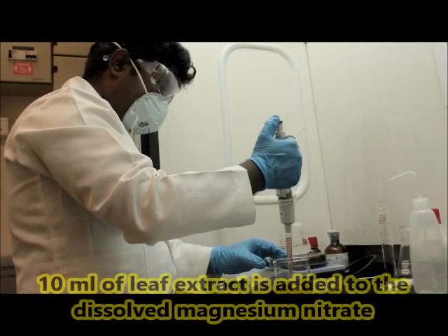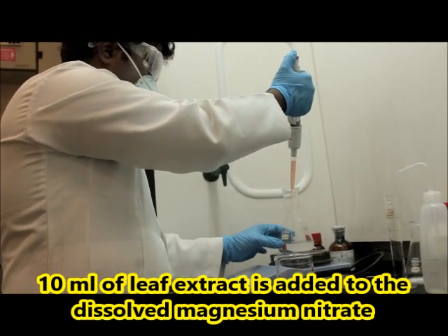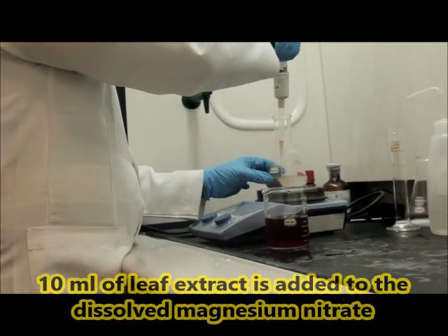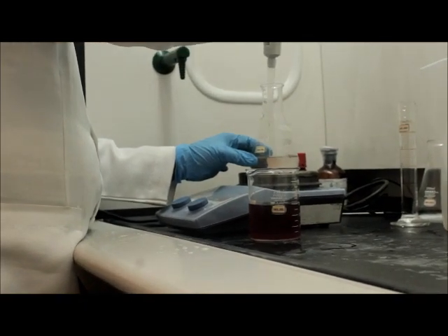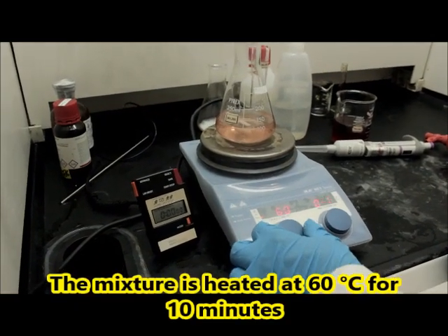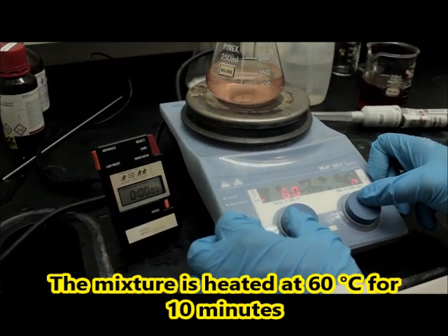10 milliliters of leaf extract is added to the dissolved magnesium nitrate. The mixture is then heated at 60 degrees Celsius for 10 minutes.